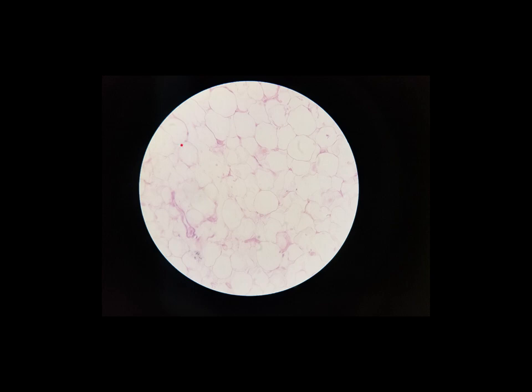And these adipocytes, most of the cytoplasm and the nucleus are pushed off to one side, like we see right here, or like we see right here. And this large open area is a fat droplet, and that takes up the majority of that cell, that adipocyte, and it pushes everything else off to one side. So the job of these cells, the job of this tissue, is to store energy in the form of fat droplets.